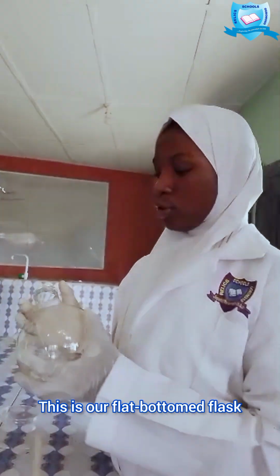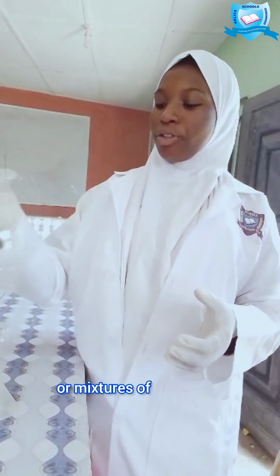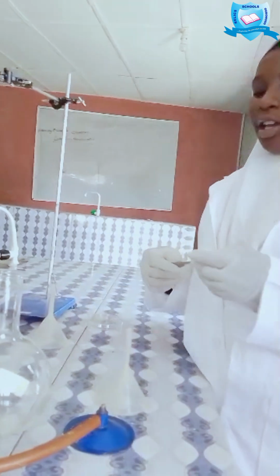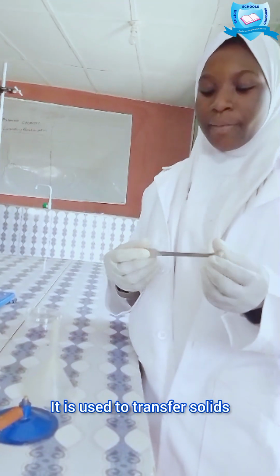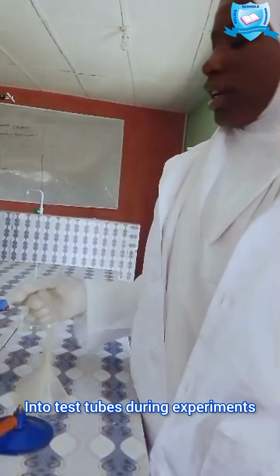These are flat bottom flasks. They are used for holding liquids or mixtures of chemicals during heating. These are spatulas. They are used for transferring solids into test tubes during experiments.